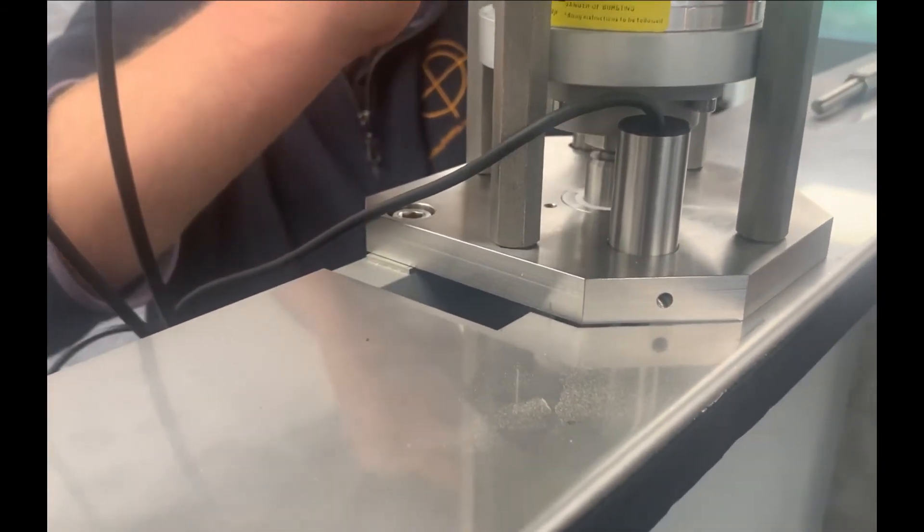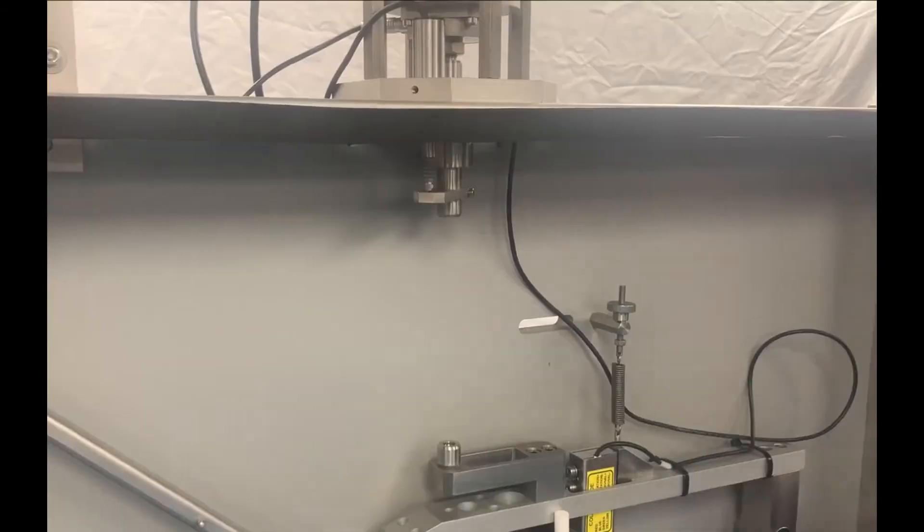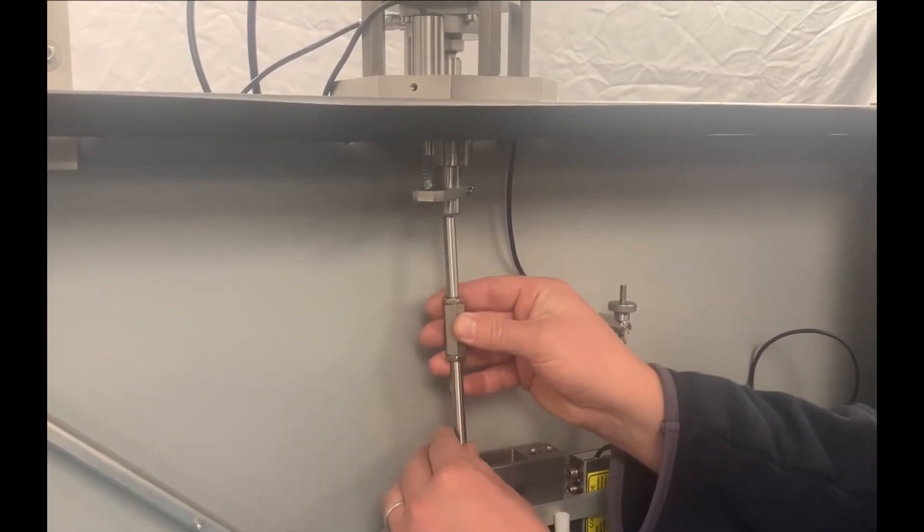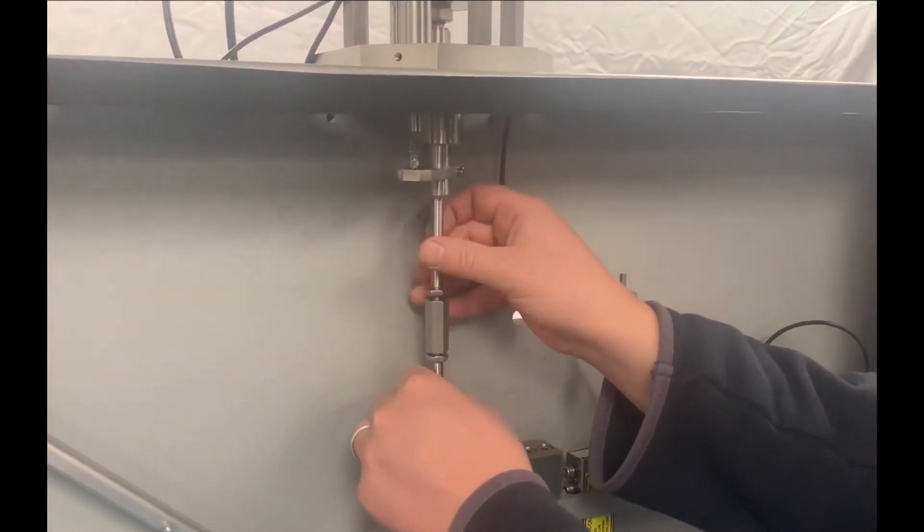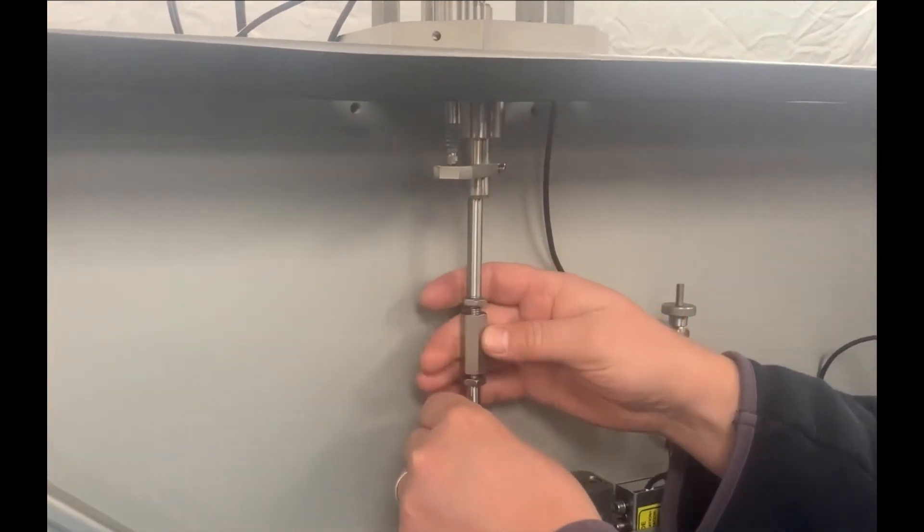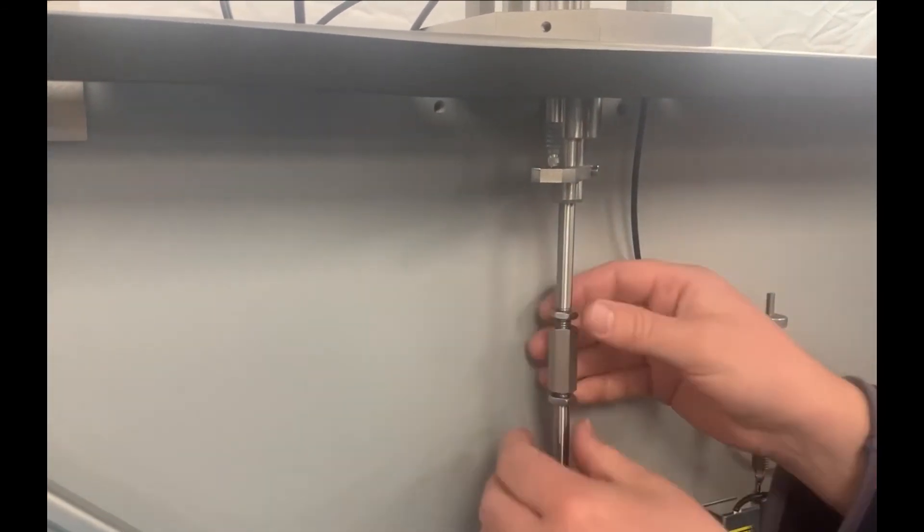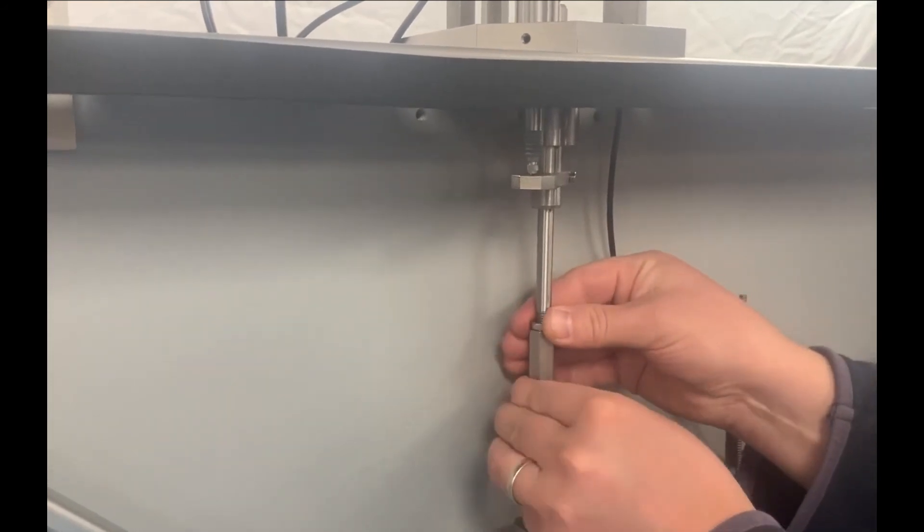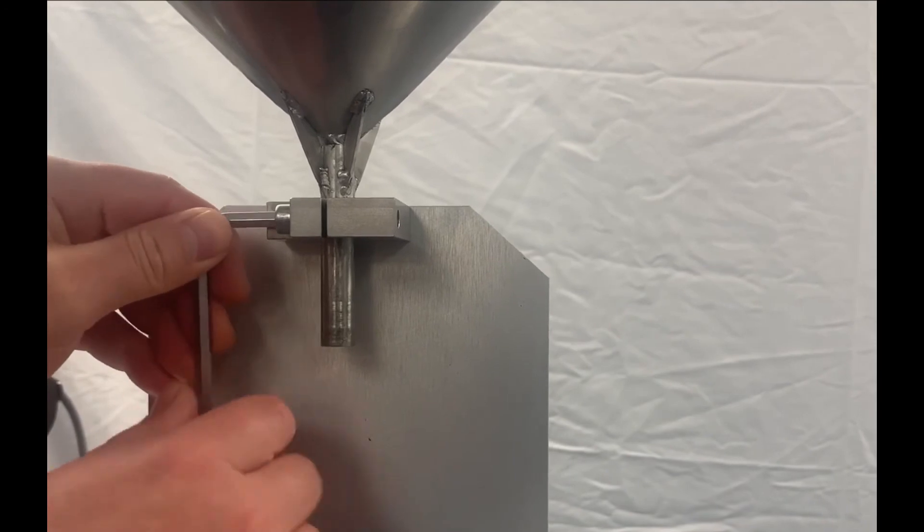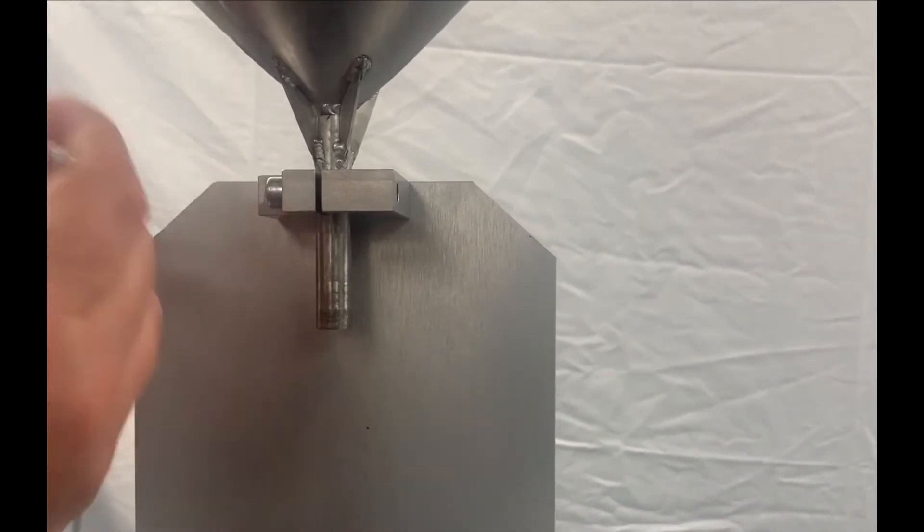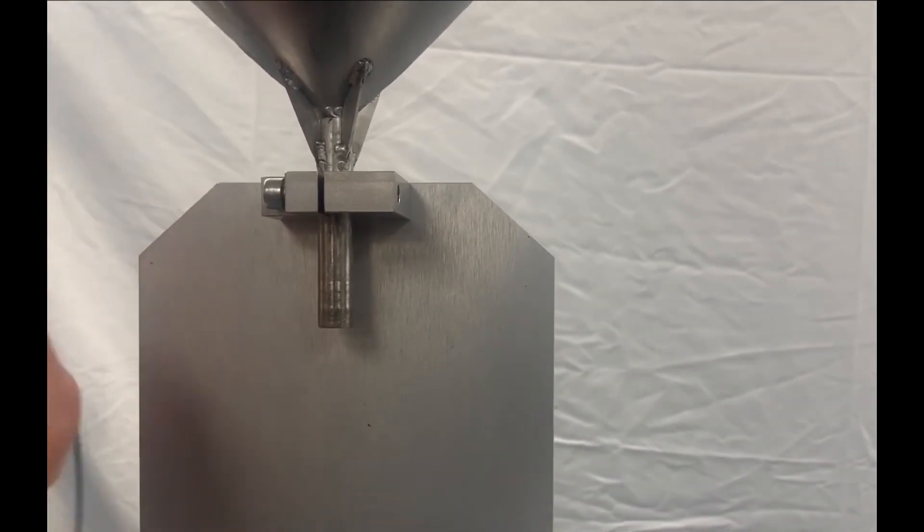Reconnect the force transducer. Next, insert and trim the load rod. Finally, remove the sand hopper and reposition on the precision abradant feed system.